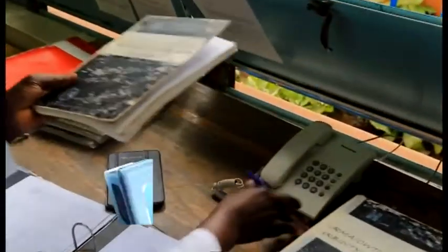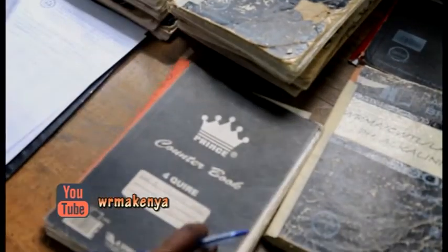After the analysis is done, we have our record books. All the analyses are entered in the record books. Now, from the record books, we enter them into our forms so that the forms are forwarded to the head of the lab for comment. We have several books for analysis. Each parameter has its own record book. So we enter them in our forms according to the results after calculations.